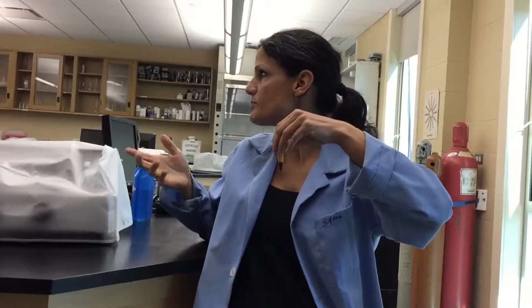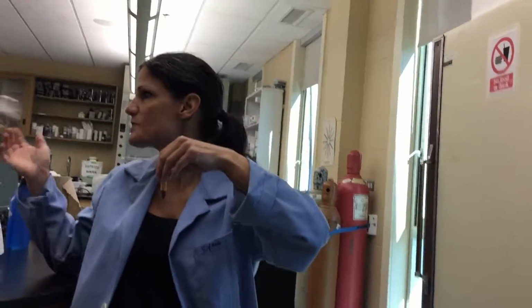500. Same. You just want it to be balanced so you don't mess with the equipment. Two ways, per volume or by weight. Most people, you won't kill the machine with the volume. Then you would put it in, right?